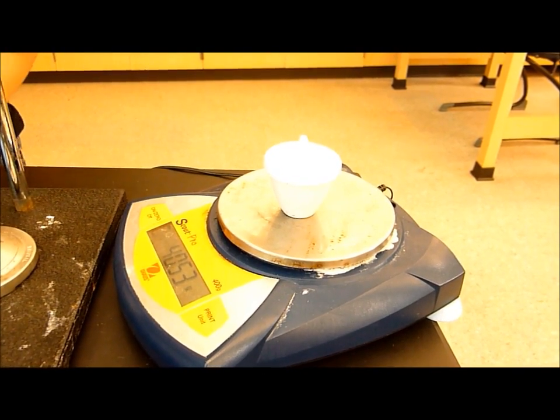Reheat the crucible, crucible lid, and sample until constant mass is achieved, and then record the final mass.